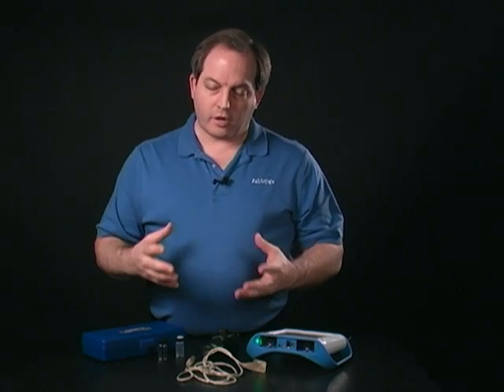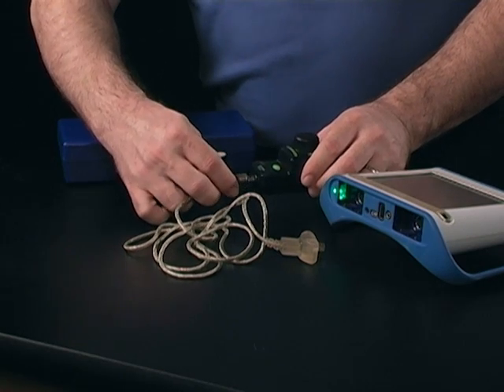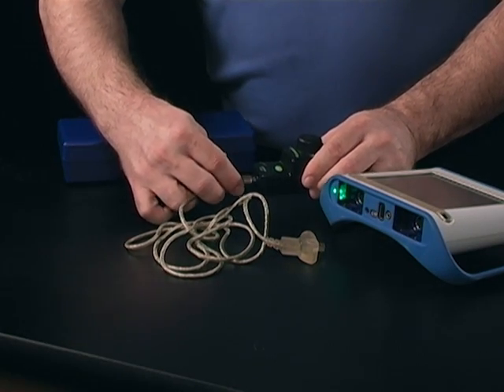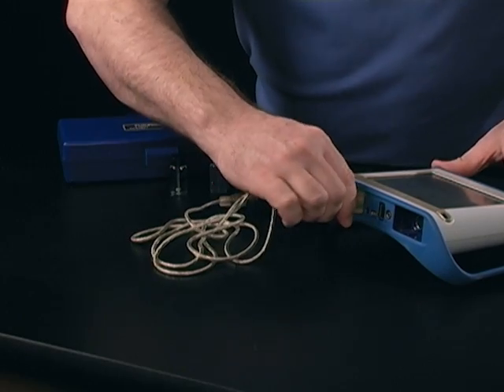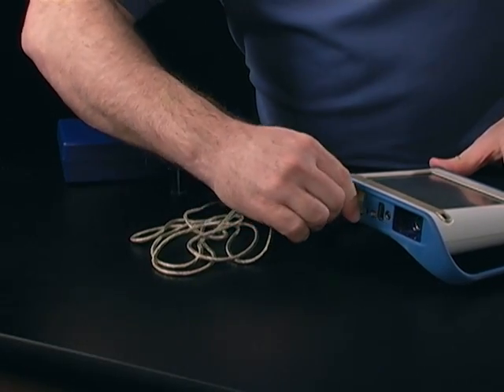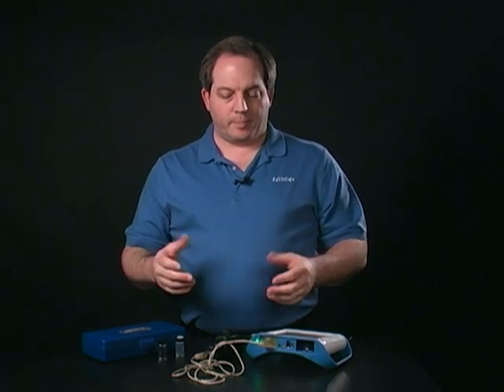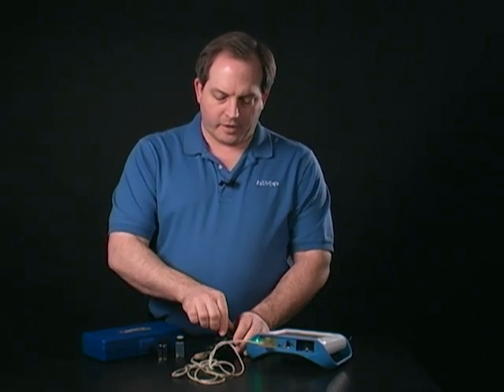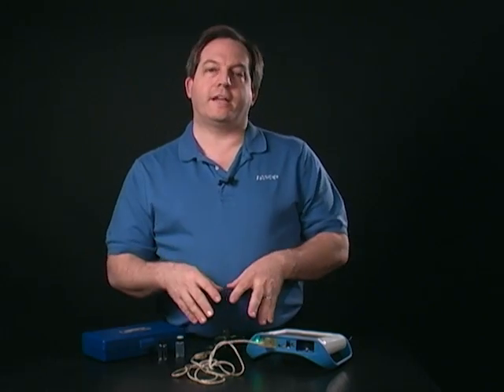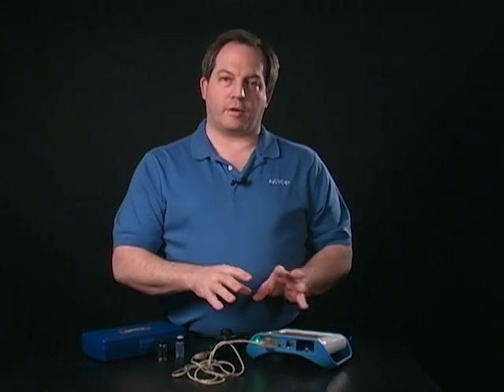To start off, we're going to go ahead and connect our turbidity sensor to our interface using the cable that comes with the turbidity sensor. Once it's connected and warmed up a little bit, we're going to go ahead and calibrate it. It has a built-in calibration, so you're going to do it on the sensor, not in the software.